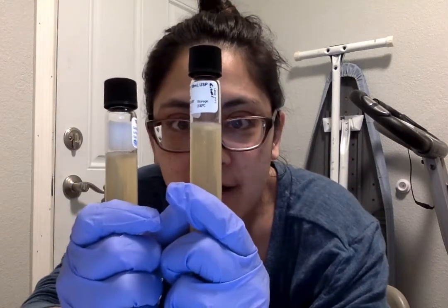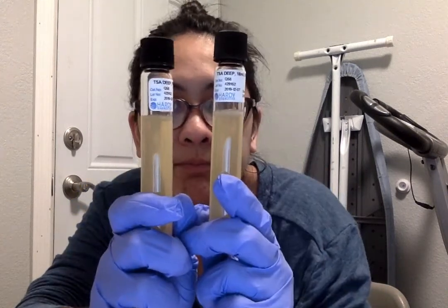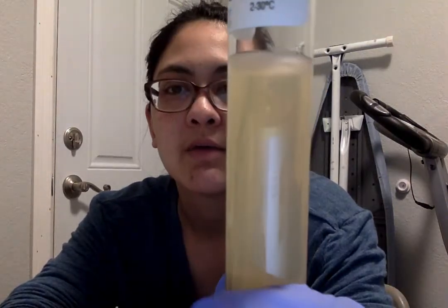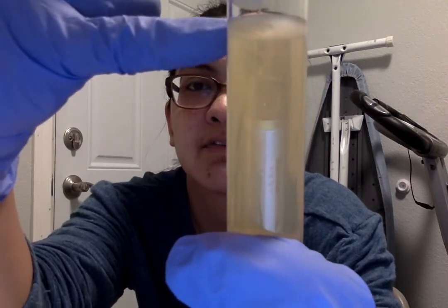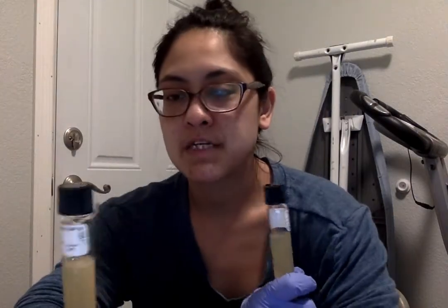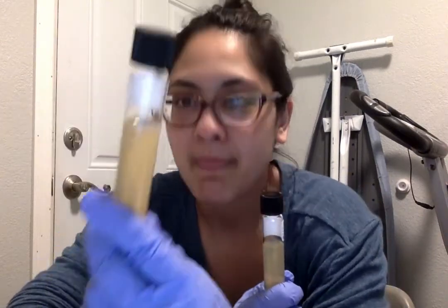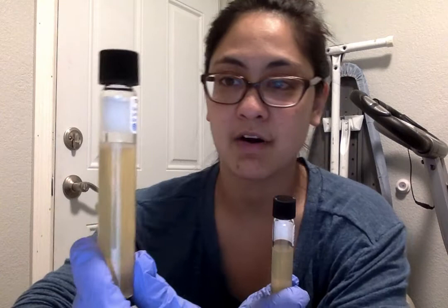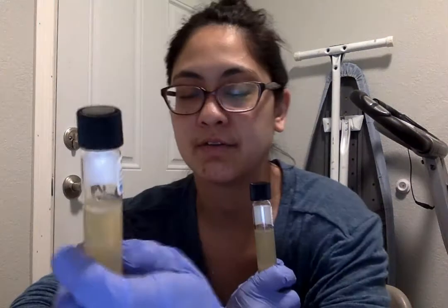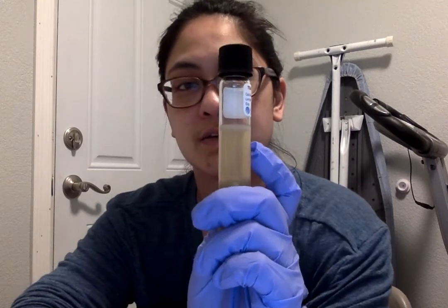But what I did find, and it's really kind of cool, in E. coli, and I don't think that the camera's really going to capture it very well, but in E. coli, from the top down all the way about 3/4 almost to the bottom of the tube, there was growth. And every angle that I keep looking at it, I do see different sides of it and exactly how far the growth extended. I probably punctured, I should have made a label of actually how far down I punctured, but maybe 1/4 of an inch into the medium.